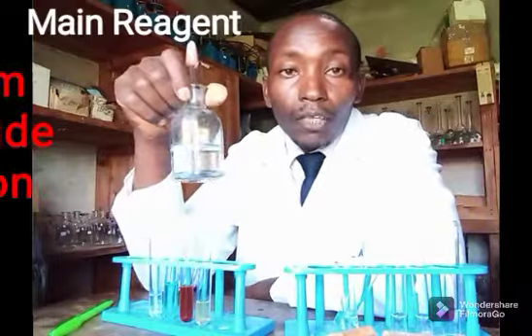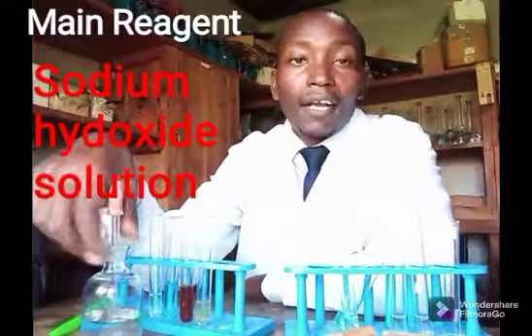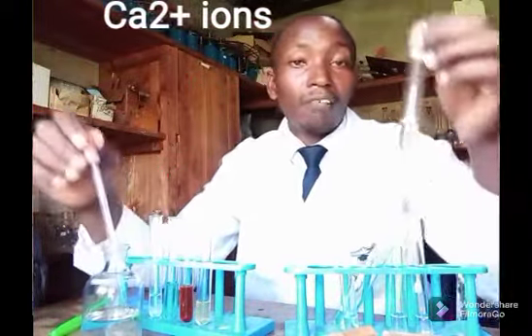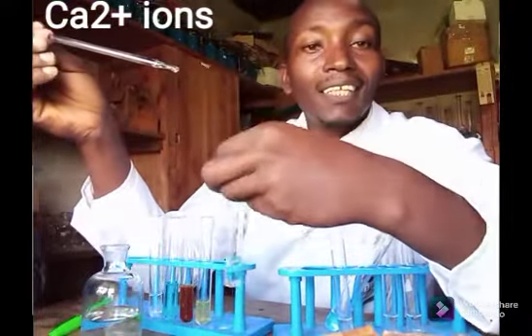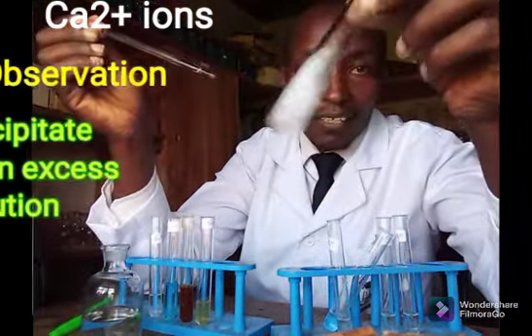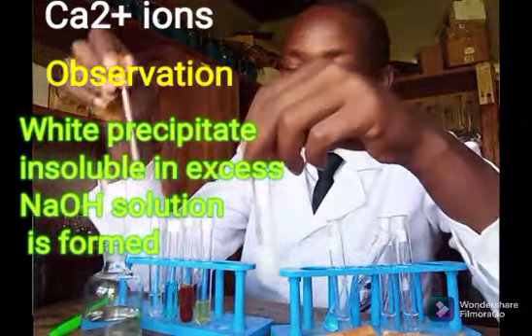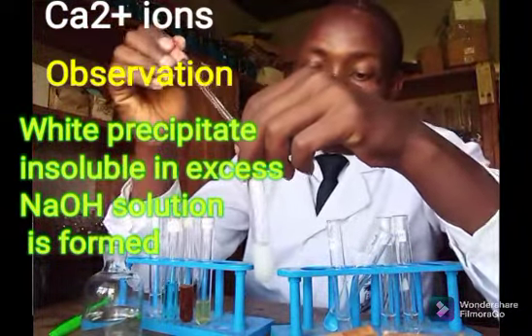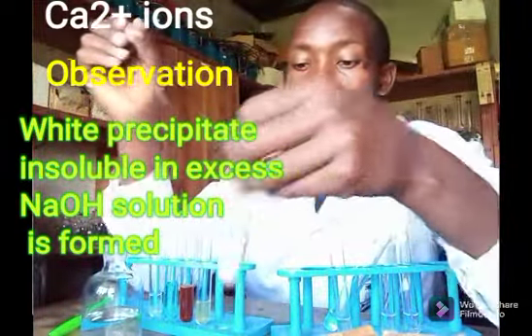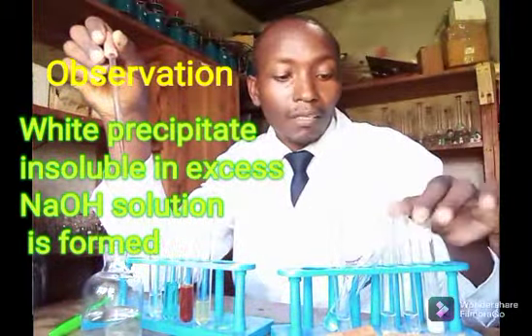So today I'm using sodium hydroxide. I will add one at a time, as I did before. In the first case, this is a solution containing calcium ions. I will add, and you can see a white precipitate has been formed. Remember, like I did in the previous video clip, I'm adding excess of sodium hydroxide and the precipitate remains.